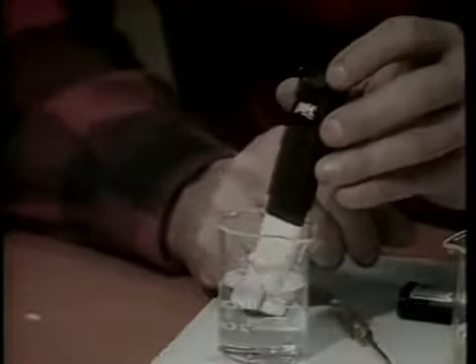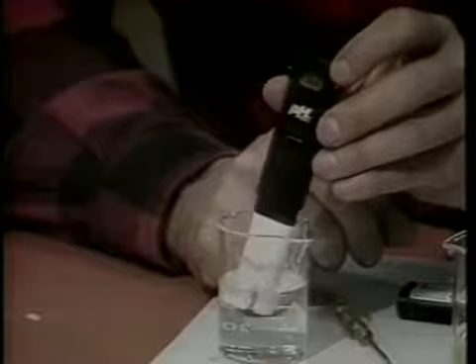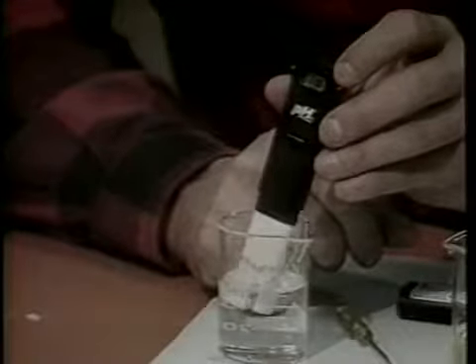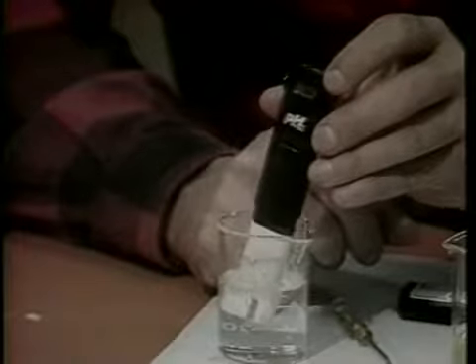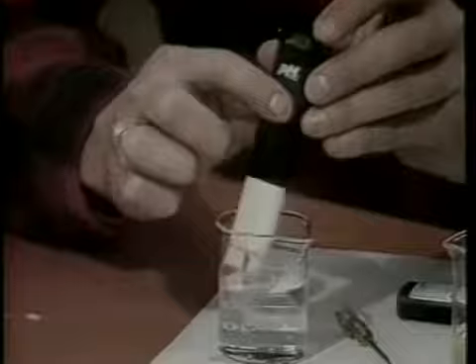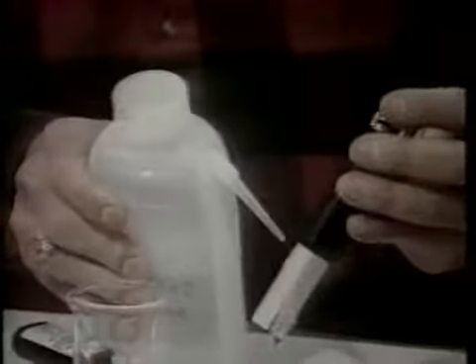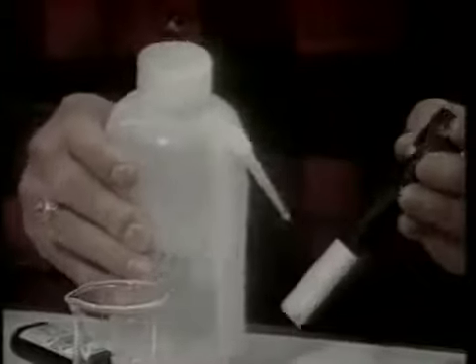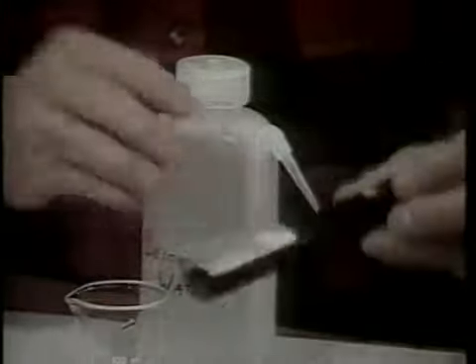To measure the pH, immerse the probe into the water to be sampled. Do not exceed the warning line shown on the meter. Stir back and forth and observe the reading. This particular model has a hold button which will lock the reading on the display after the probe is withdrawn from the sample. After each use, rinse the probe with clean water, preferably distilled if available.